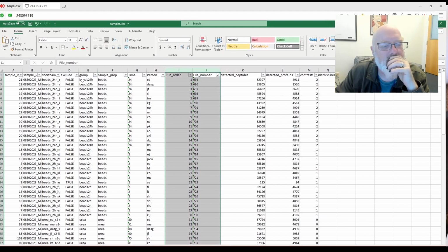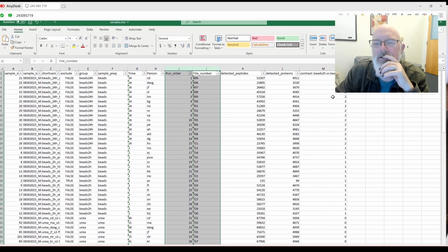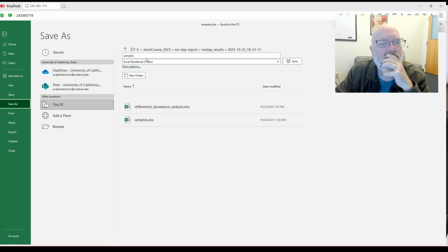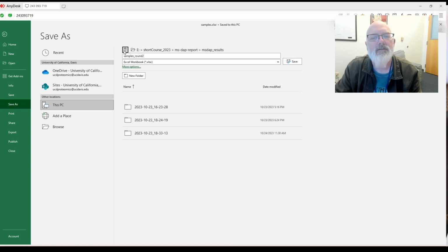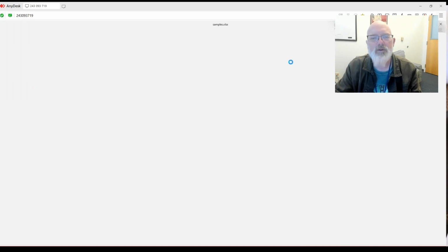All right, exclude. Should we exclude any more? Contrast, beads first 24 hours. Okay, what if we save this? So we're going to save it, and maybe we'll save as. I probably shouldn't have overwritten it. Output samples round 2. We are going to save it in MS DAP results, with the other one here. Okay, sample metadata. We'll say sample metadata round 2. Boom. All right.